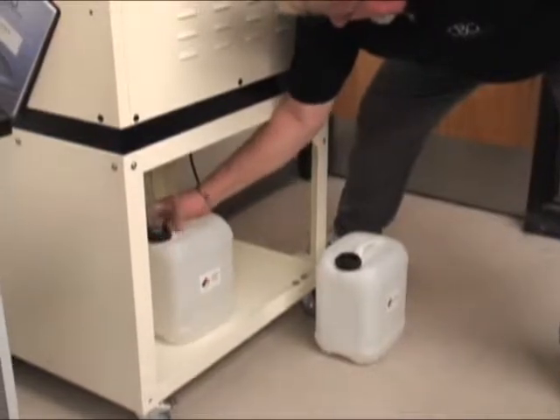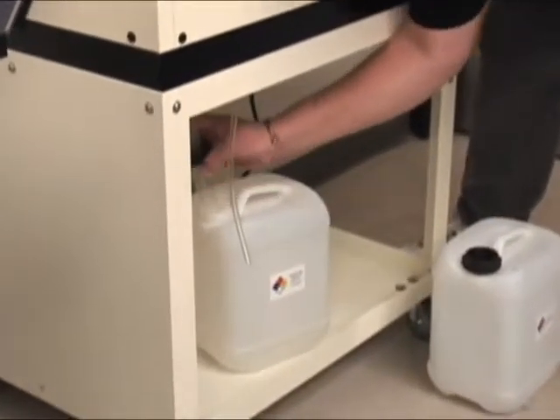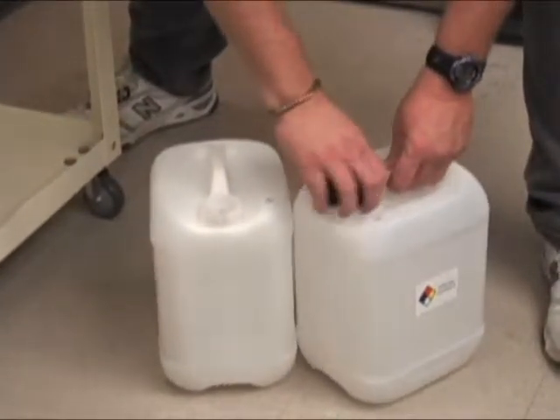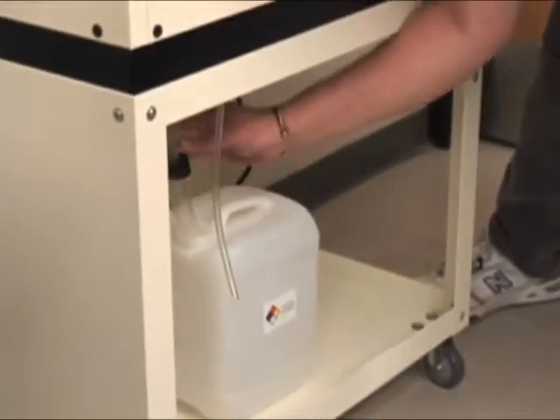I'll unscrew our little black cap here. It just has a hole around it — it goes around the big vent drain. Same container, we'll just switch caps. Take the alcohol waste container under; a couple of turns later, this will go down.